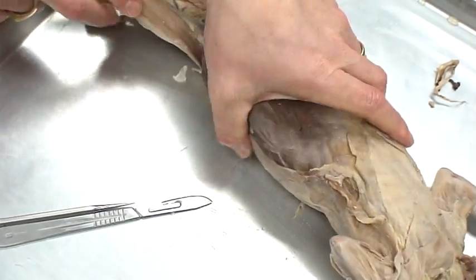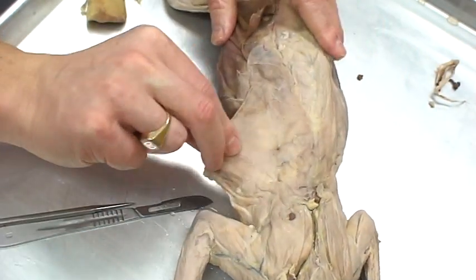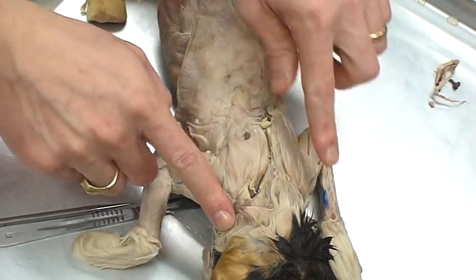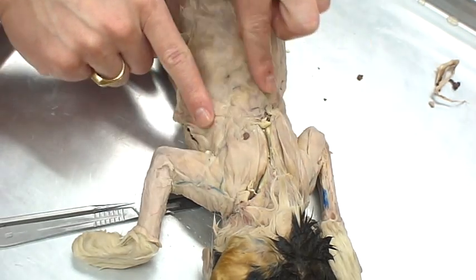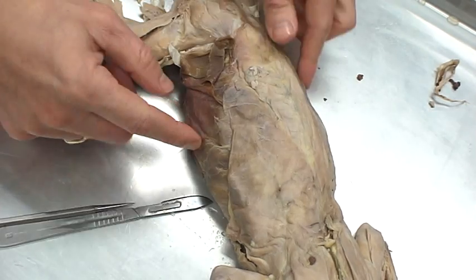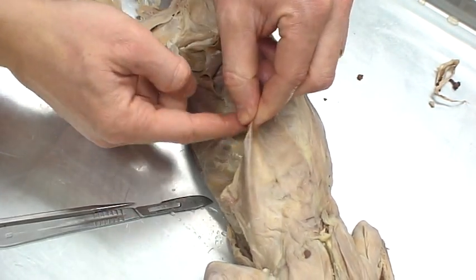Moving on to the back of the cat — the head is right here. We've got the trapezius from up here down to here. The latissimus dorsi is the big wing-like ones that go down here.